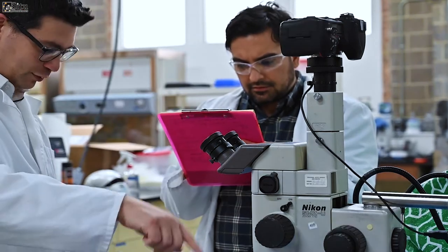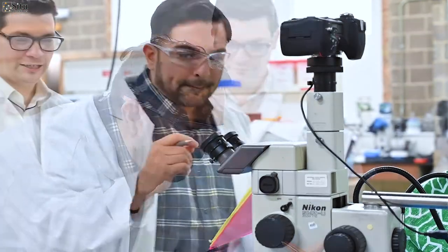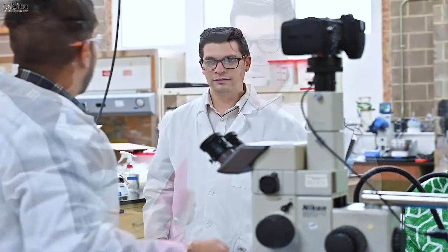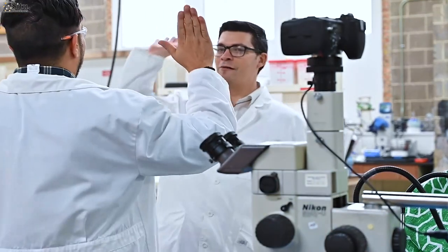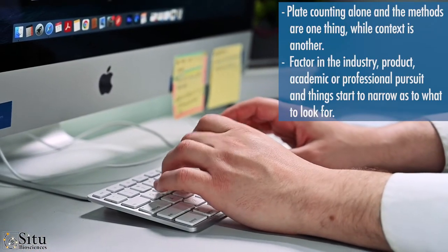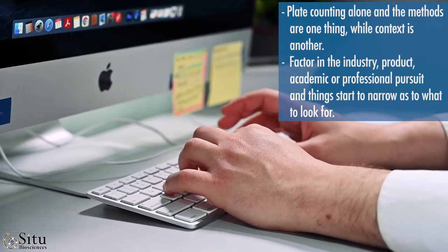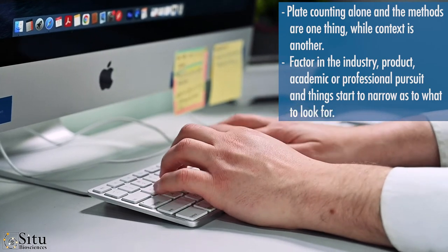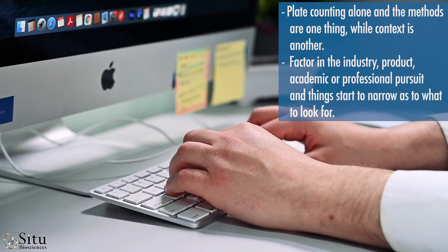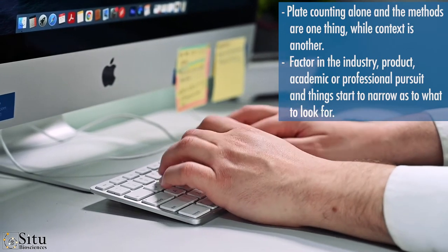When evaluating which methodology is most useful, determining one's needs first is essential. What is it that you're trying to accomplish? What kind of information are you looking for? And then from there, you can look into the details of the approach itself. Plate counting alone, and the methods, are one thing, while context is another. Factor in the industry, product, academic, or professional pursuit, and things start to narrow as to what to look for.